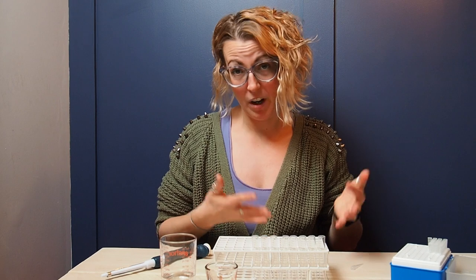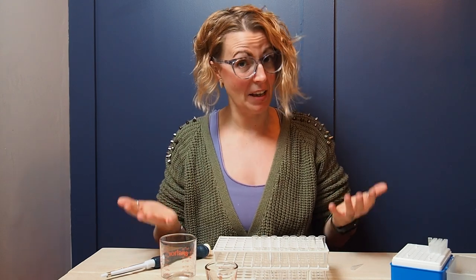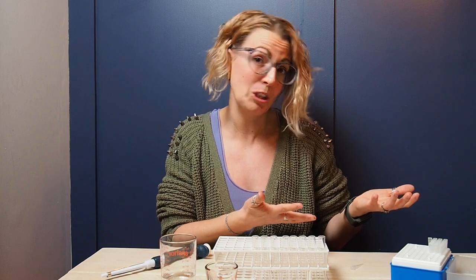For today's purposes I'm going to start with a one-in-two dilution, because visually it'll be easier to see what's happening with my soy sauce. However, in your lab a one-in-two dilution as a starting point would be quite high and very expensive, so I'd recommend looking at your manufacturer sheet for your antibody, seeing what their recommended concentration is, and then starting a little bit more concentrated than that. So if they recommend a one-in-100, I'd probably start my dilution with a one-in-50.